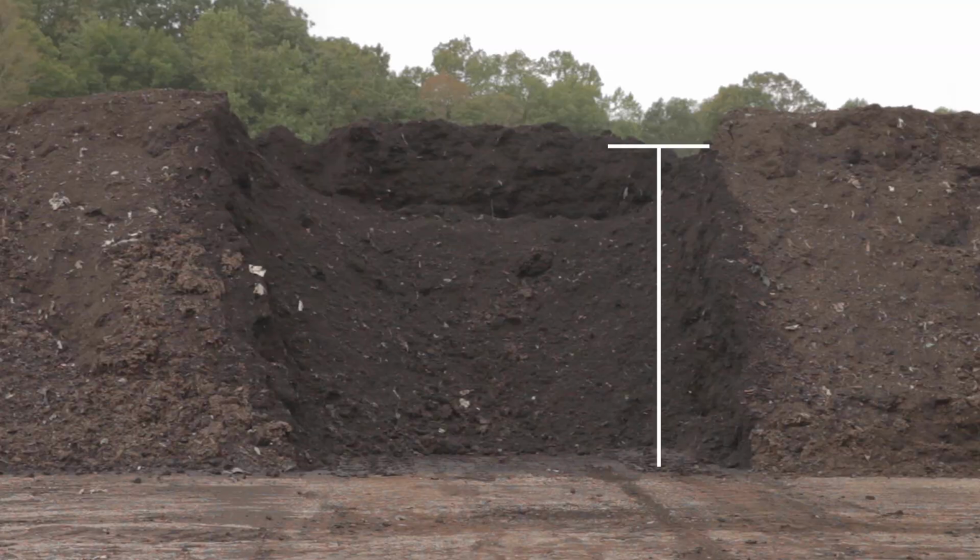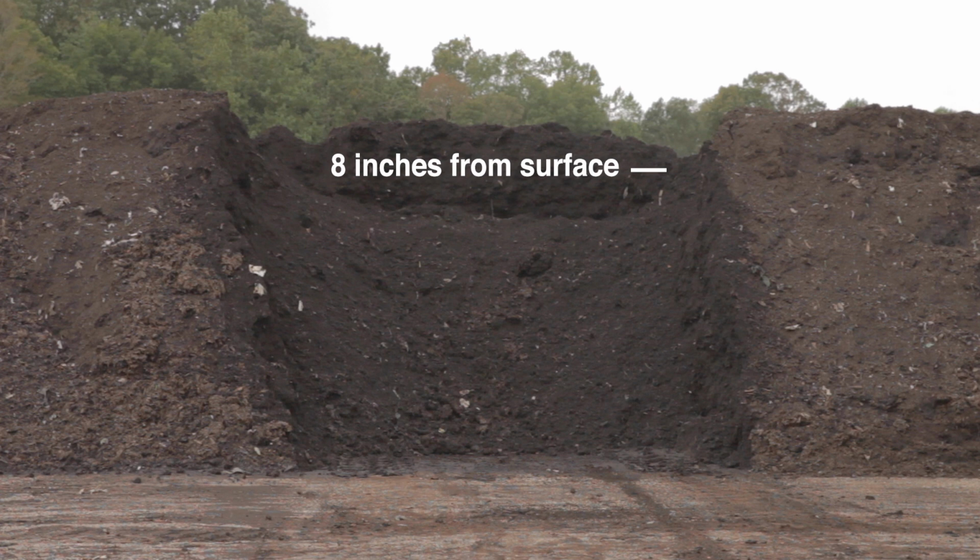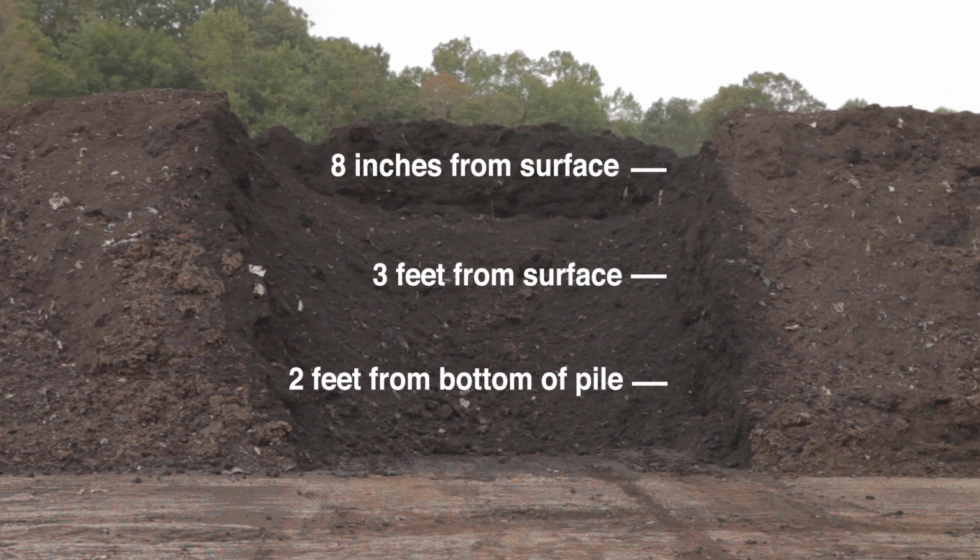For instance, if your cross-section is 8 feet, your first subsample could be at 8 inches from the surface, the second subsample could be at 3 feet from the surface, and the third subsample could be 2 feet from the bottom of the pile. When collecting subsamples for area sampling, use the same method just described, but collect 4 1-quart subsamples at each depth chosen for sampling, and composite these 4 to provide the sample that will be representative of the material at that location and depth within the pile.